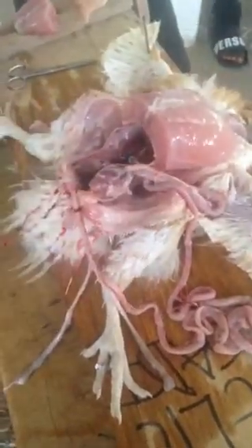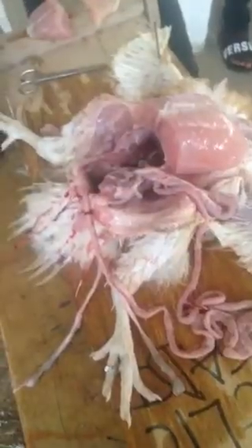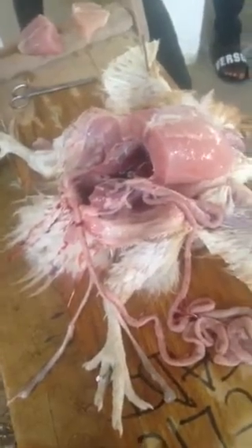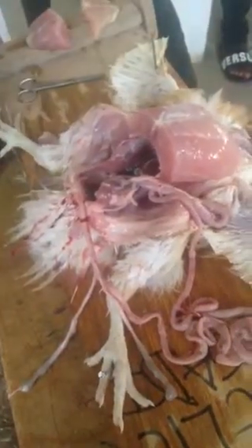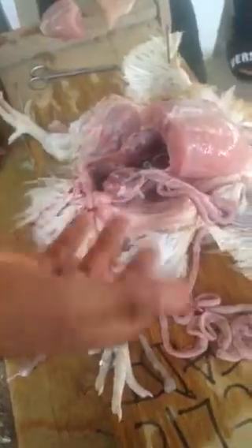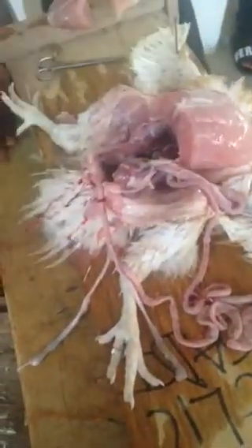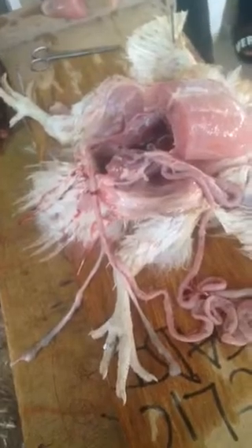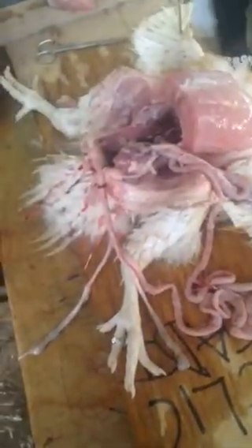At times, they may ask you to crush part of the liver lobes, to remove part of the liver lobes and test for what? Protein. Or test for what? Enzyme. Yes. Or even part of the pancreas. Or they may ask you to tear part of this flesh and test for protein. Knowing fully whether you have already done the test of protein, you know what it will produce. Just crush part of the flesh, let the examiner be going around and see what you are doing.